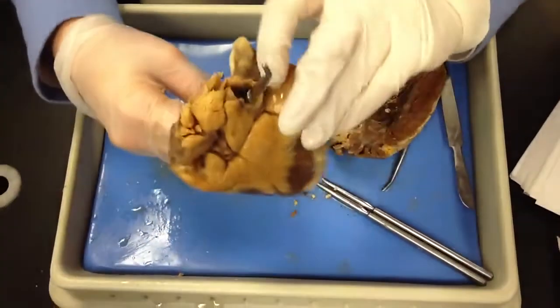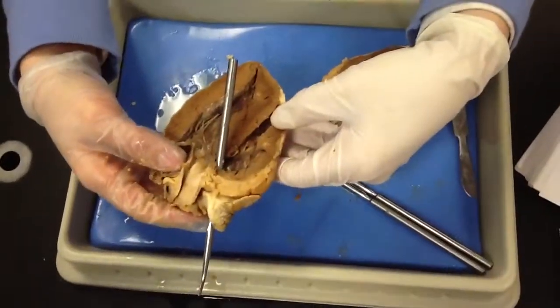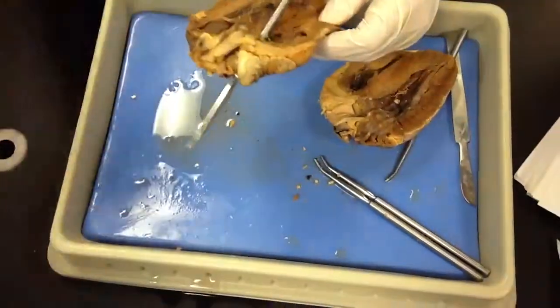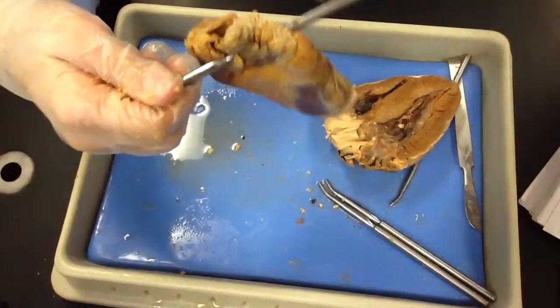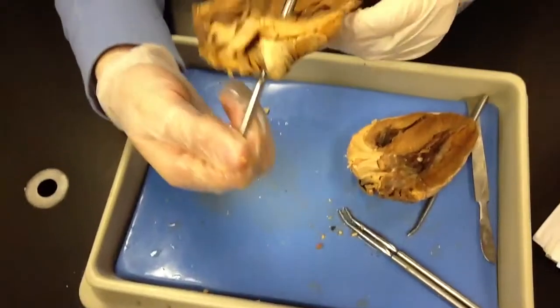It's an atrium. Well, we're talking about the right side of the heart. That's going to be the right atria to the superior vena cava. Superior vena cava, right? Yes, the vena cava. Because we're talking about from the tissues. So if it's right side, it's coming from the tissues. It looks like part of the ventricle though, because I didn't see the valve.